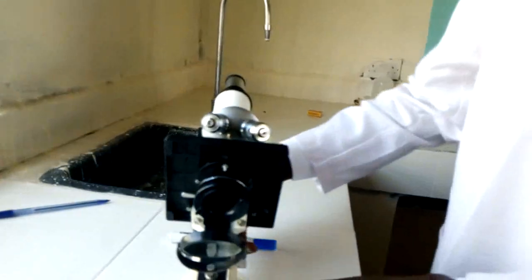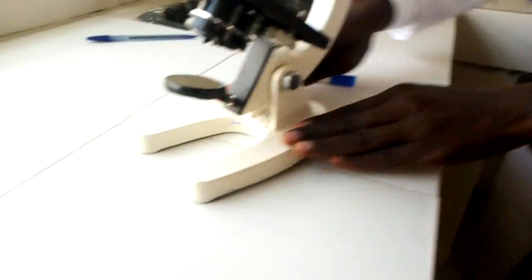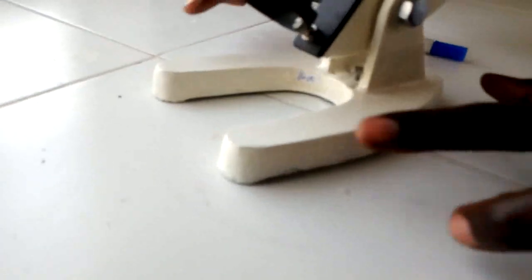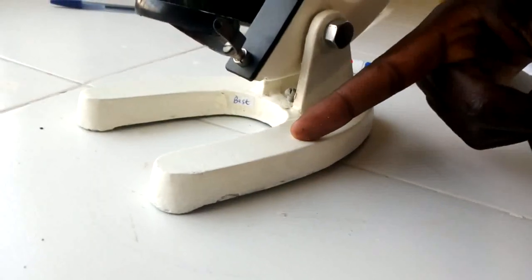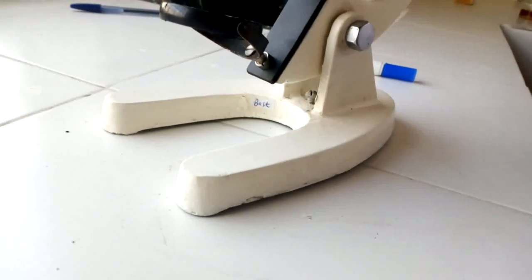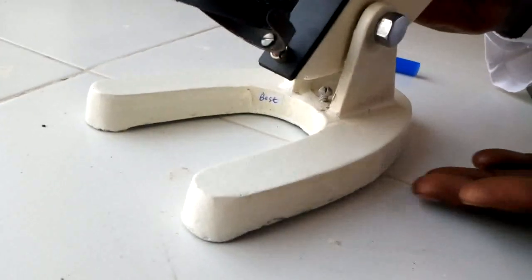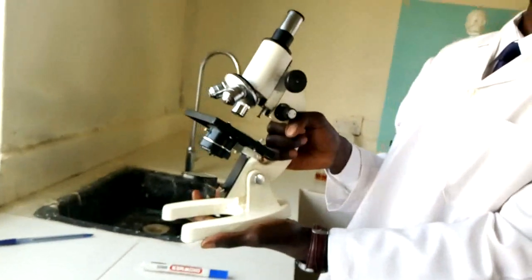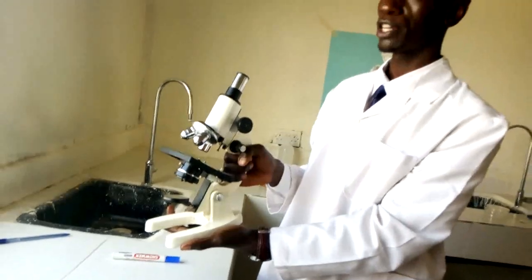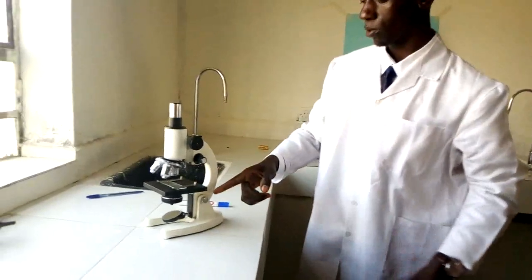Let me return the condenser. We have this part referred to as the base. The function of the base is to provide firm support to the microscope. It is also the part I hold when transporting the microscope — you need to transport the microscope using both hands.